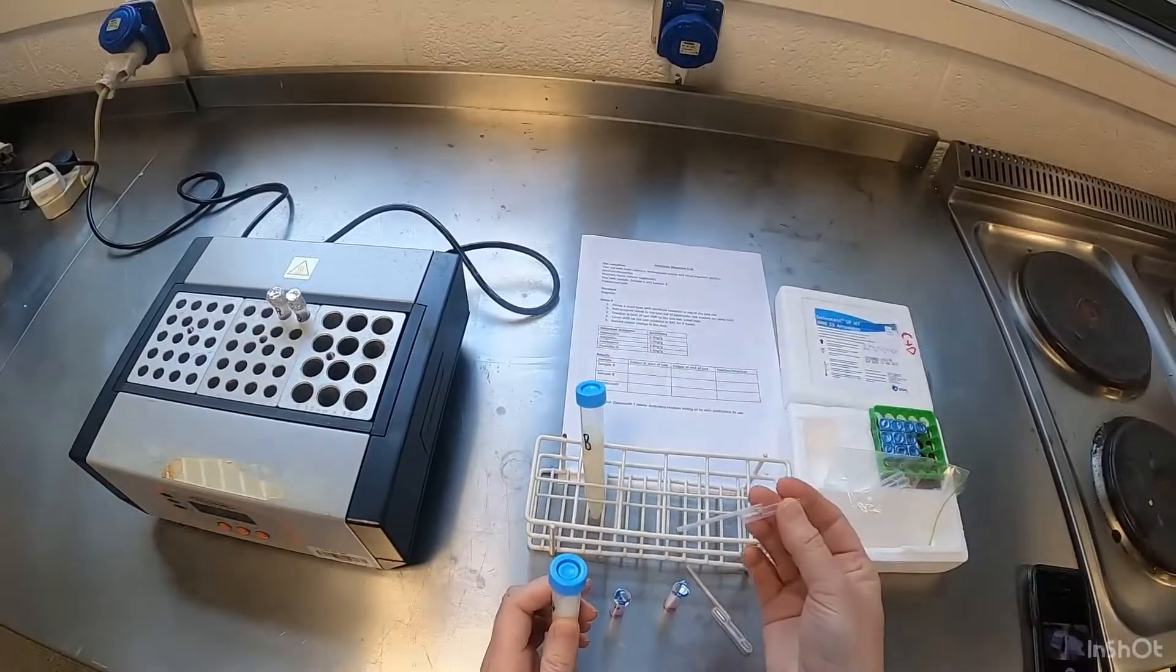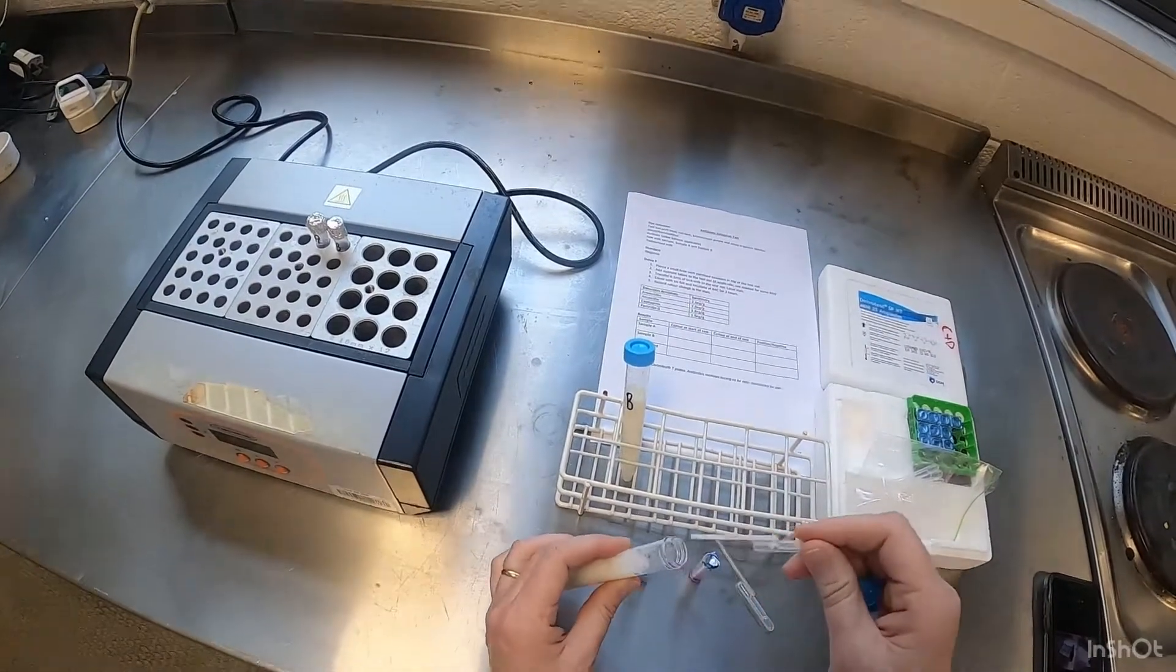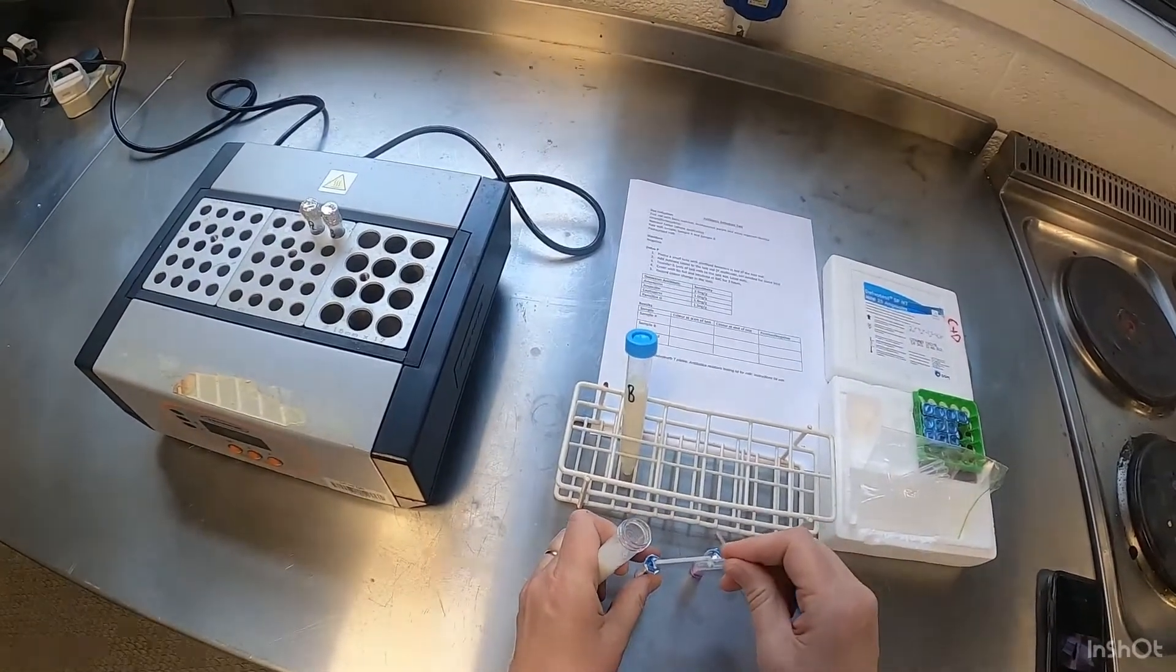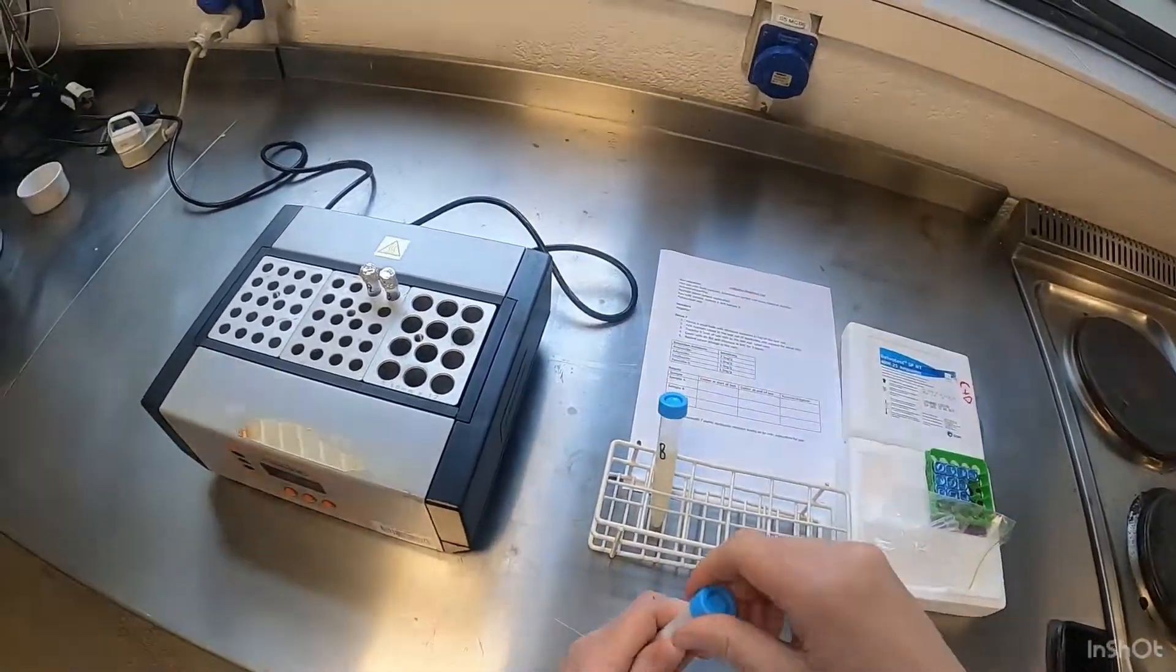I'm going to take sample A and I'm going to have my little pipette, squeeze the top of it, suck it up like that and enter it into the tube.